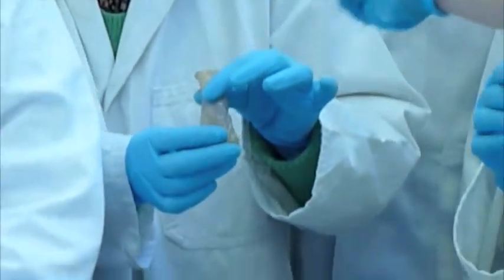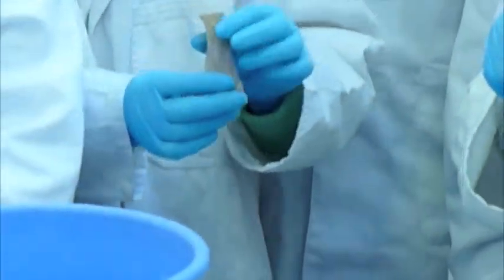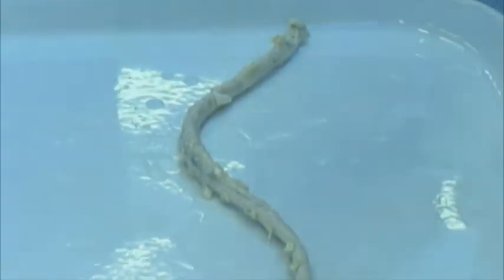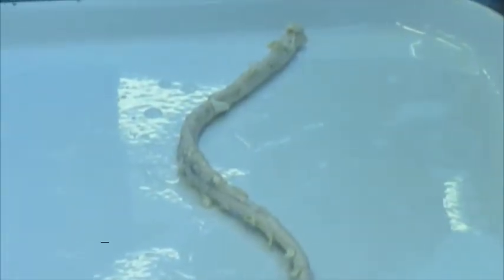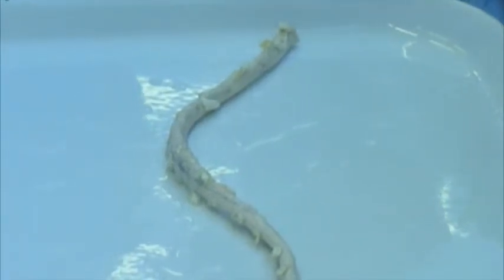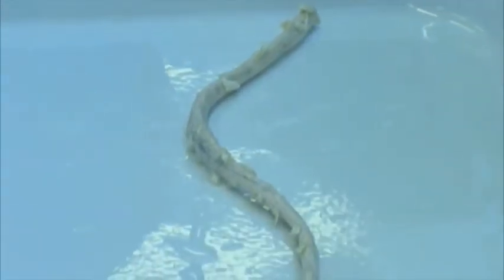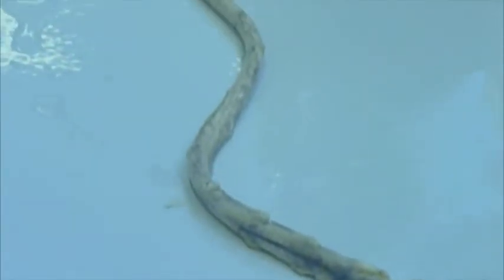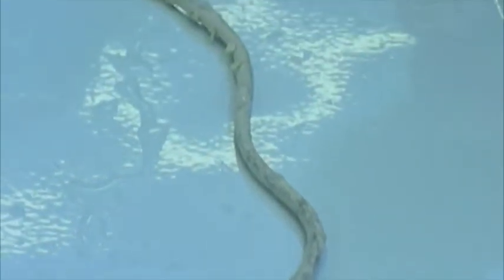White and grey matter. And that cord is dorsal, ventral. So, if it's thicker, what might that imply? You have more of something. Well, plexus comes into it. It's more neurons, more lower motor neurons.